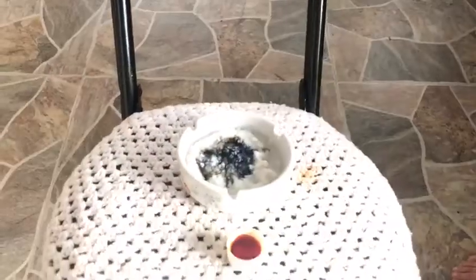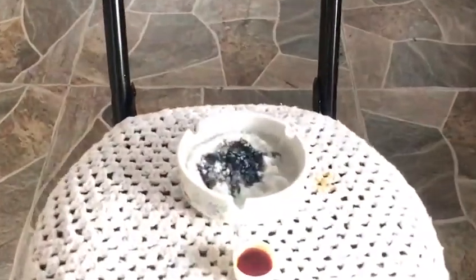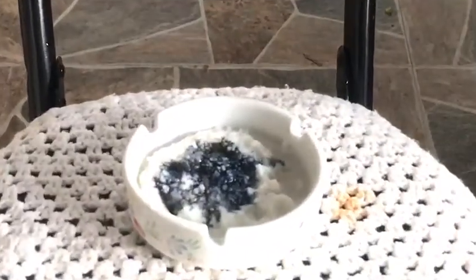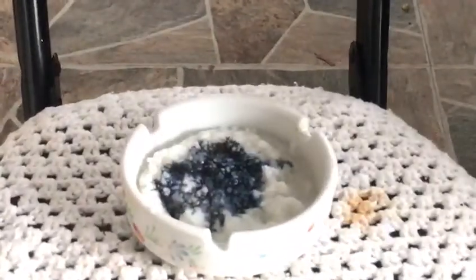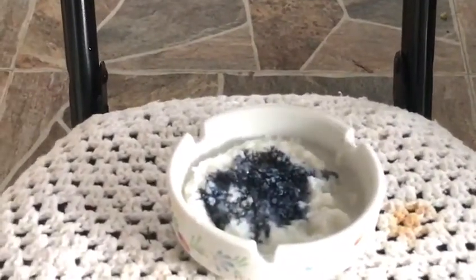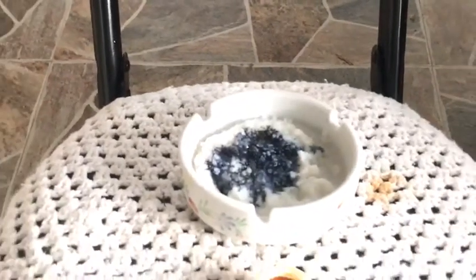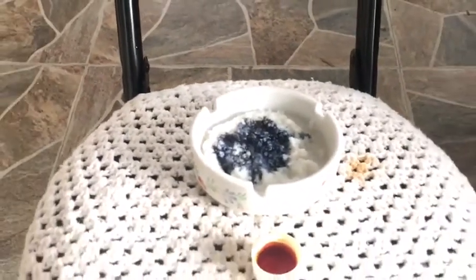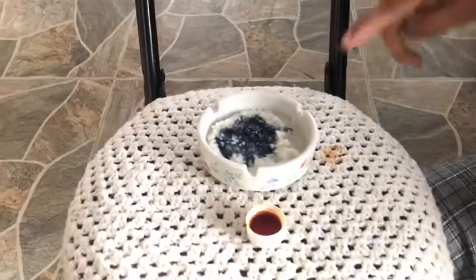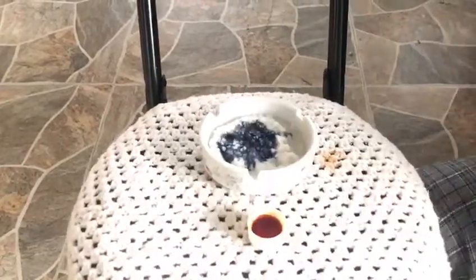Now you can see the brown color iodine turns into a purple-blue color. So we can conclude that cooked rice has starch — that's why the brown color iodine turns into purple-blue color. That's all, thank you.